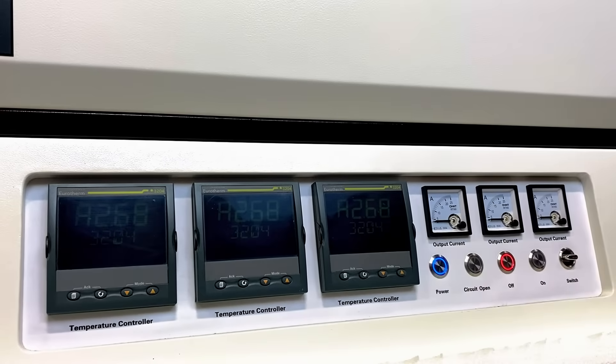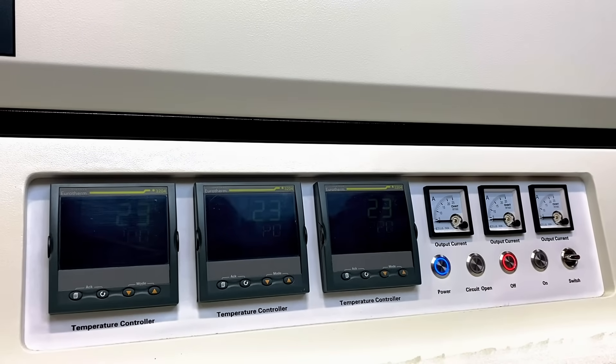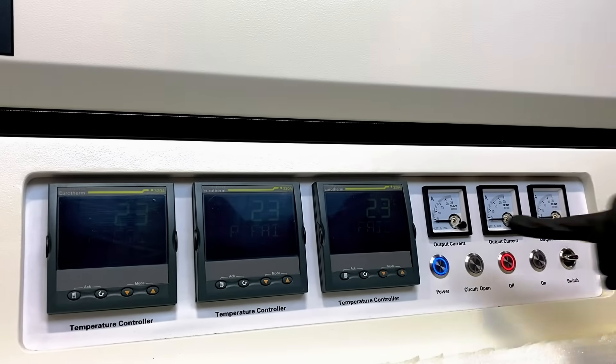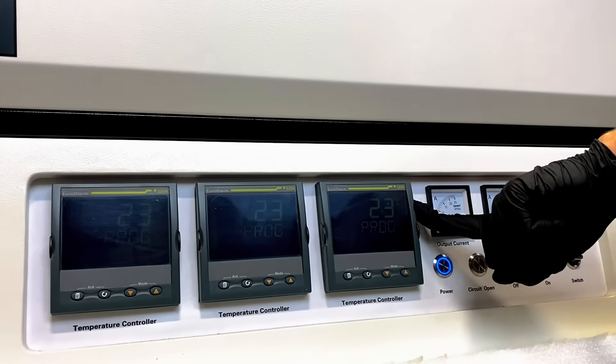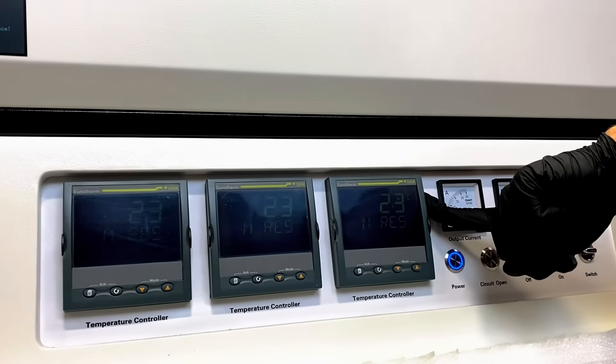This will begin our Eurotherm temperature controllers. Our Eurotherm temperature controllers will start displaying ambient room temperature, what is read by the thermocouples.